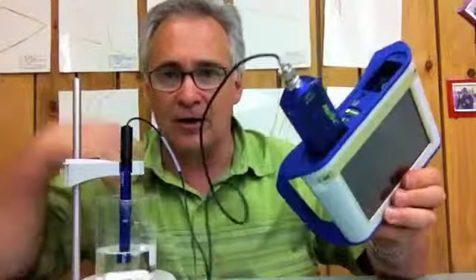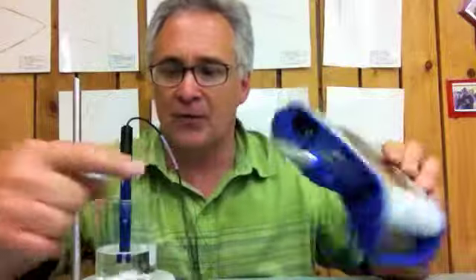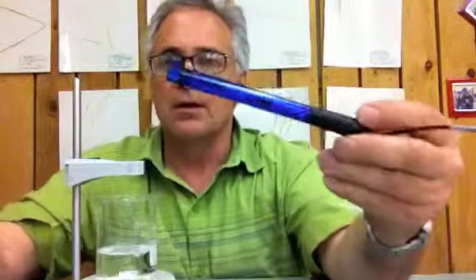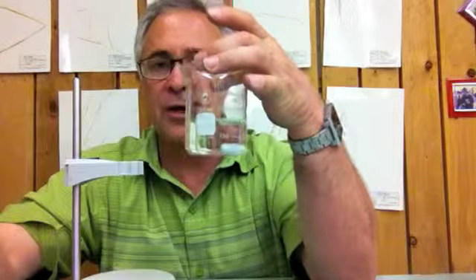All right? So make sure you get your data logger, your pH amplifier, the pH probe. You'll need this 200 ml or 400 ml beaker, 100 mLs of water, your stir plate, 10 cc's or 10 mLs of vinegar, and you should have everything ready. So that's the first part. The second part, we're going to use club soda. So make sure you get all the parts together, and we'll see you in just a minute.